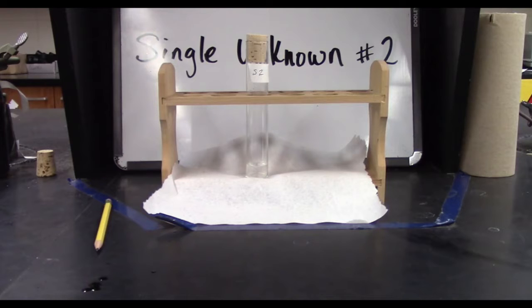A solubility test was performed and the compound was first mixed with water. There were some Schlieren lines and then it formed a single layer. The test tube became warm to the touch. This indicates that there was a chemical reaction that took place and the compound is soluble in water. The pH of the mixture was about 11 or 12.